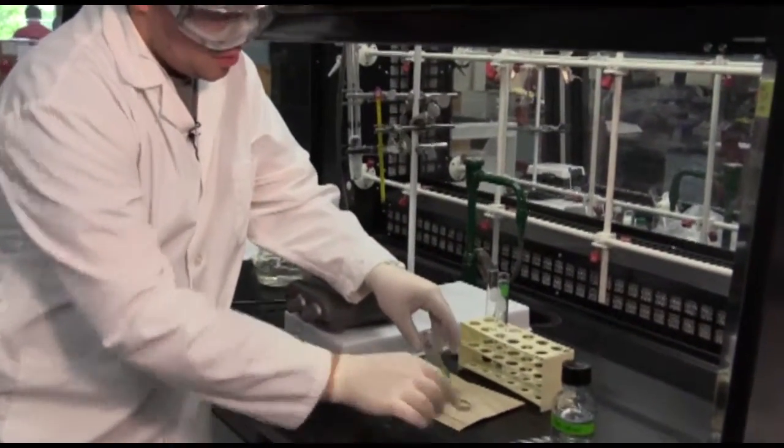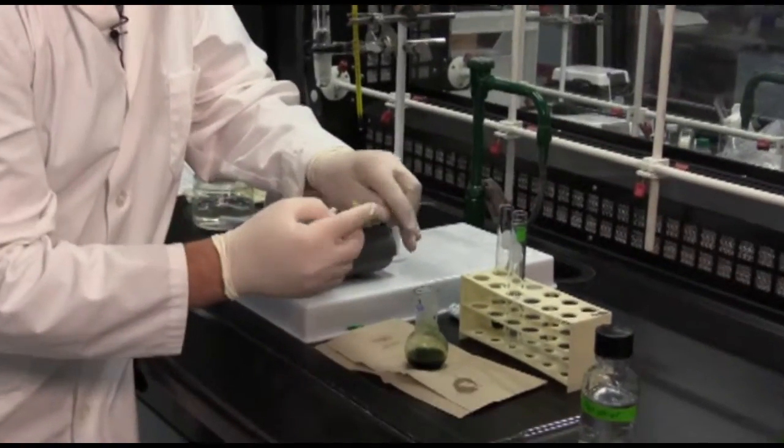Once you've done this, grab your pasteur pipette and attach the bulb.